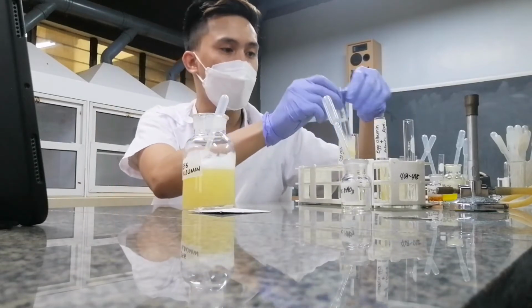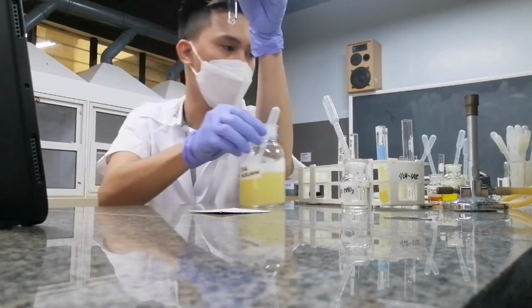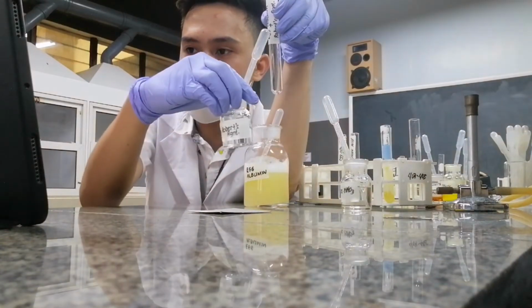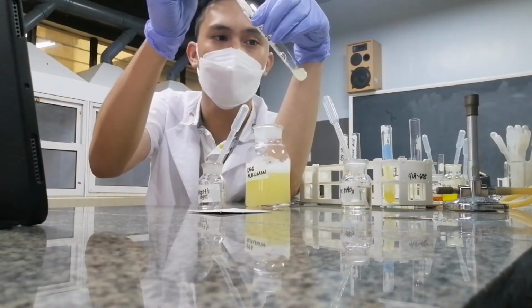So let's now try your Robert's test. Okay? Let's try your Robert's test. So I have here now my Robert's reagent. I need distilled water, ma'am.